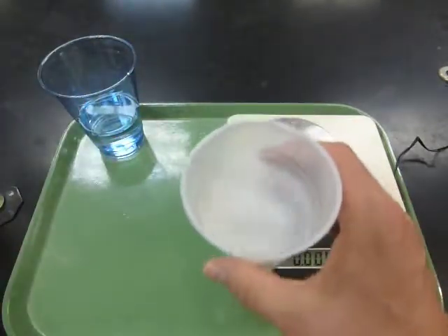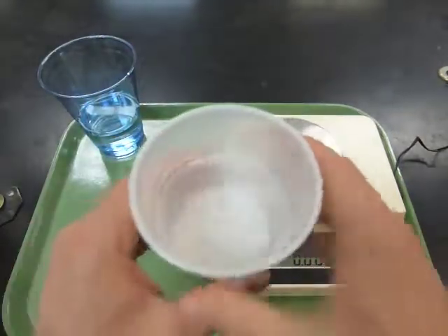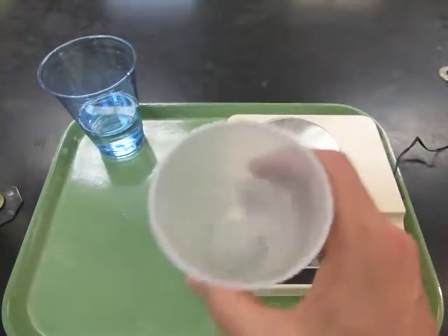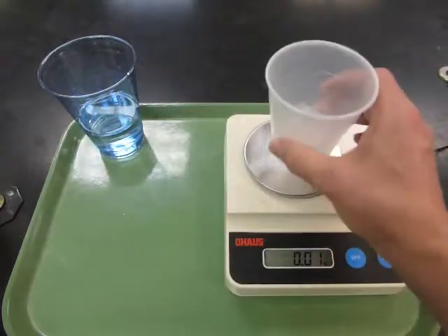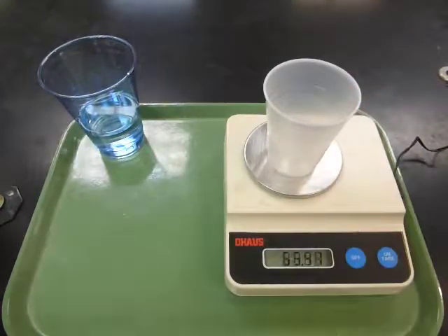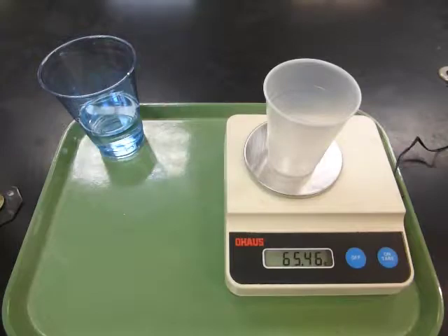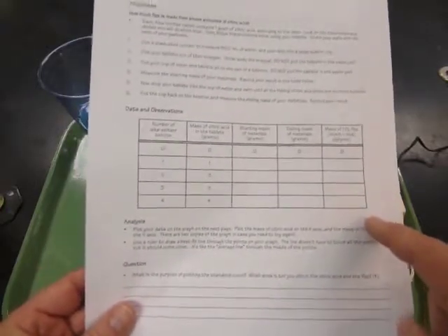Make sure it has all fizzed away. When all the bubbles are gone and you don't see any more bubbles, put it back on the balance and re-weigh it to find out what the ending mass is — how much fizz went away — and record that. Make sure to share all of the data with all of the partners in the group so that you can plot the results in the next step.